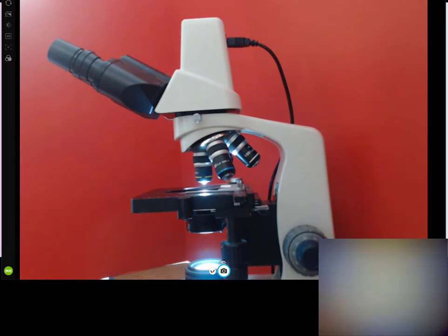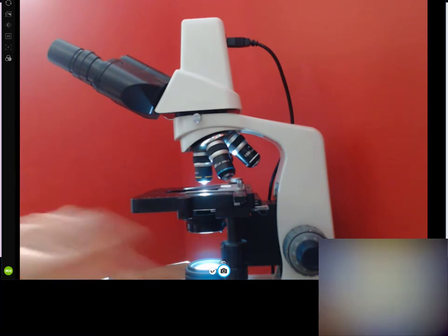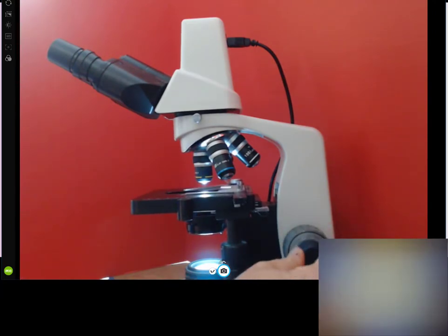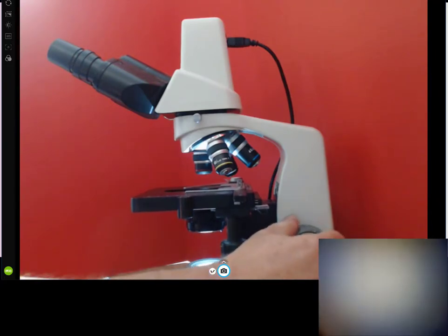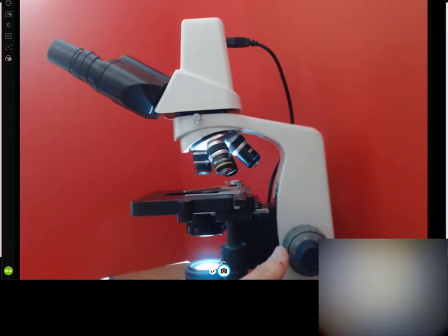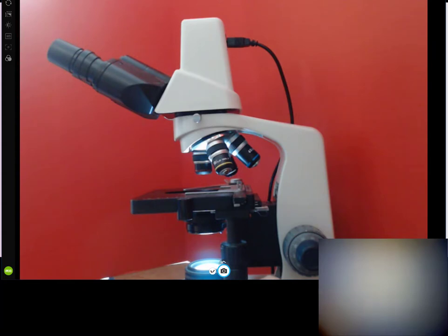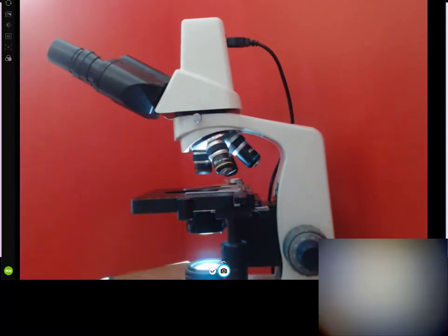The manipulators over here move the stage up and down — that's the coarse adjust. The fine adjust moves it very slightly. On the 4x we can use the coarse adjust. What I usually do — and this is where students who haven't used a microscope before can use this tip — is move the stage all the way up, then down just about a quarter of a turn. That will get you in the ballpark to start with.